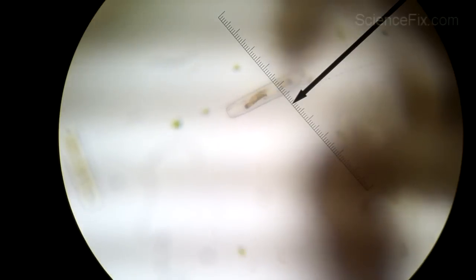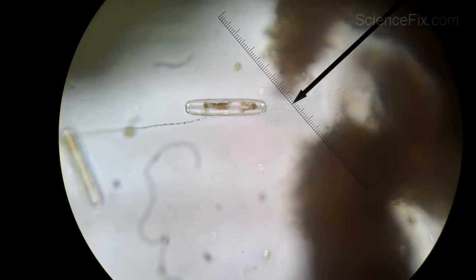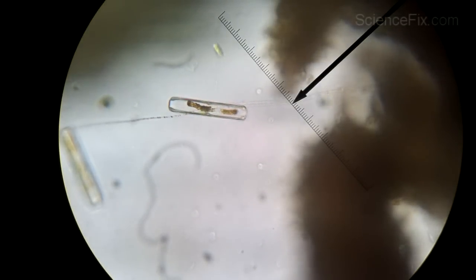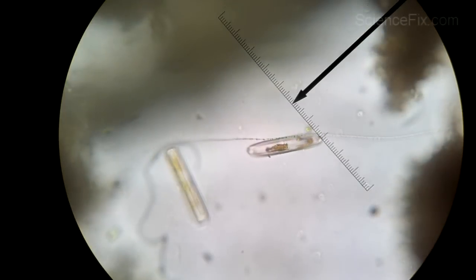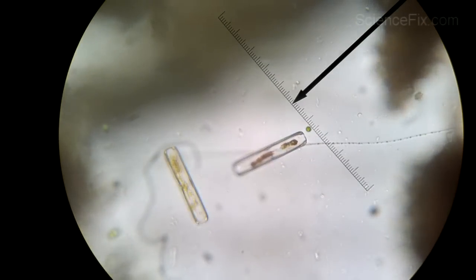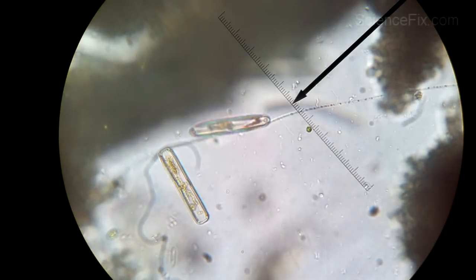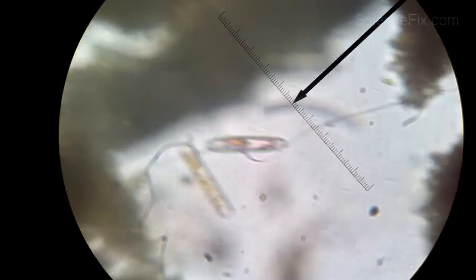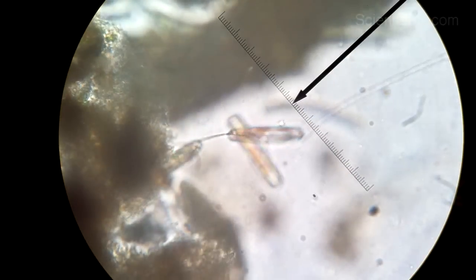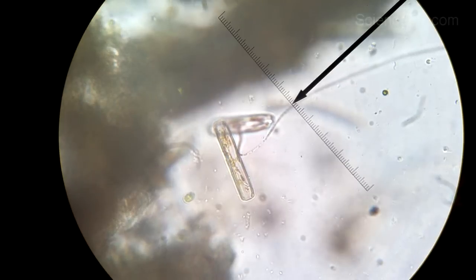Sometimes you just don't know what you're ever going to see. This one I'm not too sure what it is — this might be a diatom. But it's a really good example of how you need your microscope skills. I turn down the diaphragm so you get a little bit more contrast. It looks like some kind of propulsion, and it's hard to tell if it's photosynthesizing — it has a brown material. It's just a very peculiar organism. Students will take a look at it and have no idea what it is, but it stirs their curiosity to find out more. This is a good opportunity for them to seek out that information instead of having you tell them.